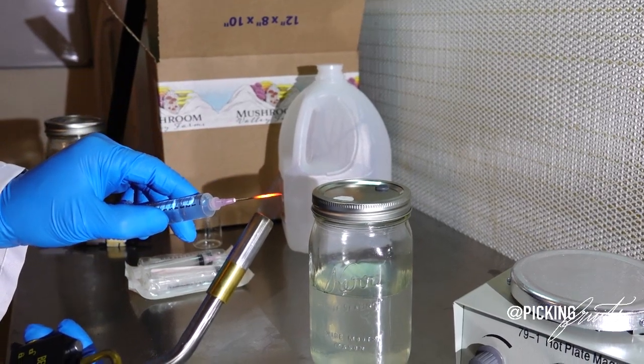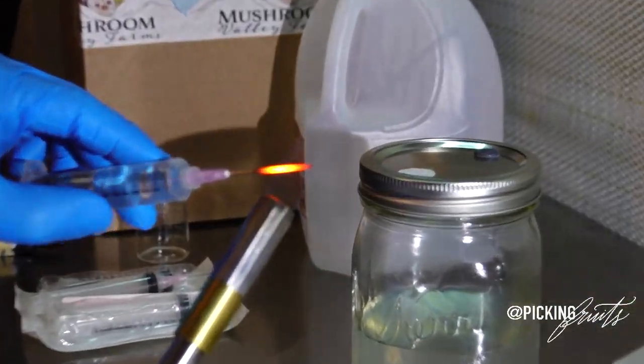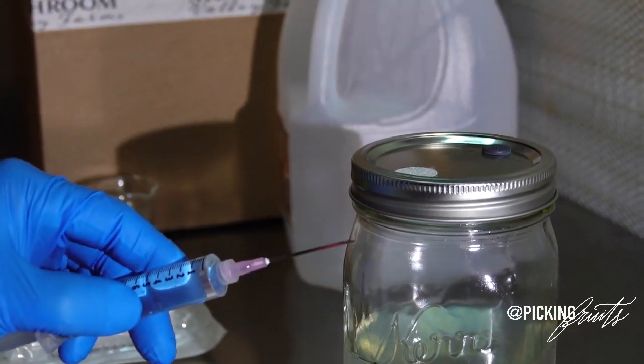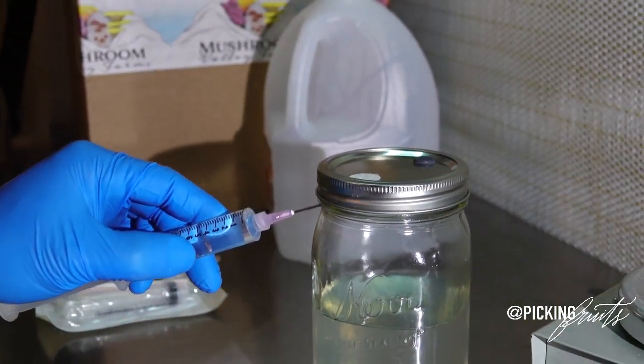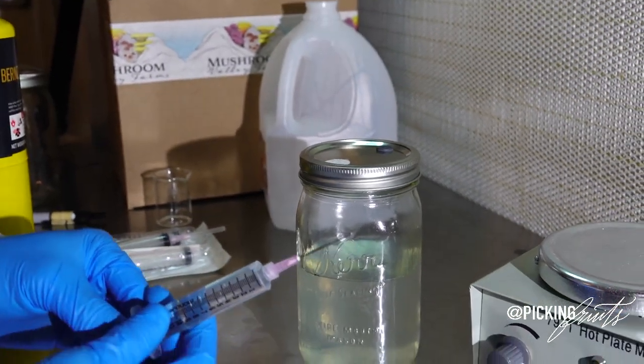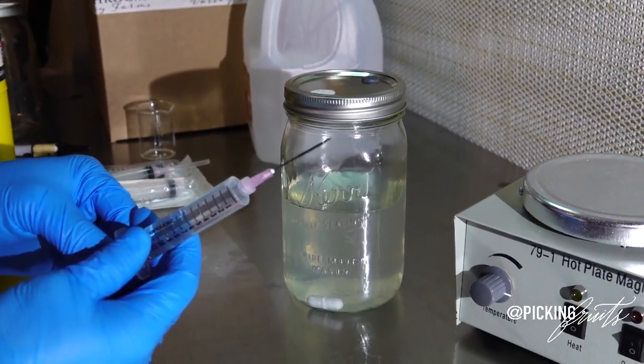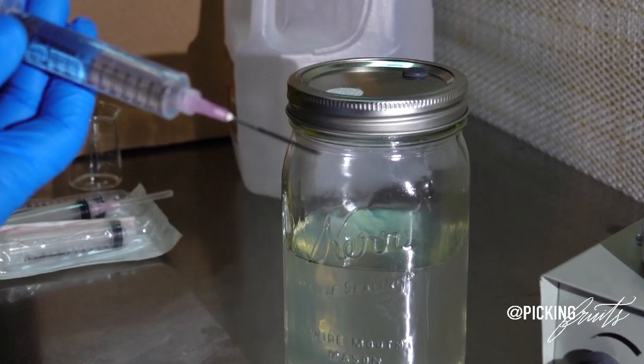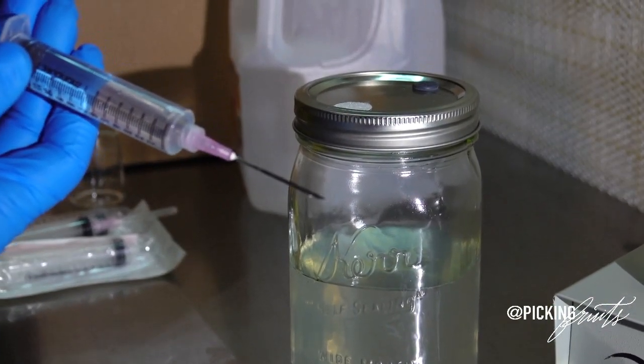So one, two, you see red hot, cut the flame. Always make sure that your flame is completely out before you set your instrument down. And then we're going to cool down the needle by dripping some of our inoculant out.